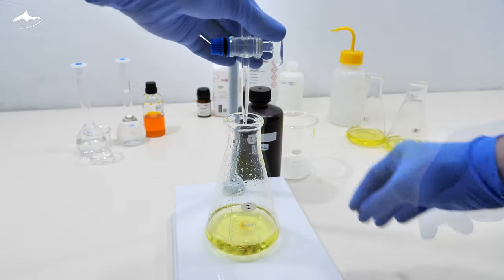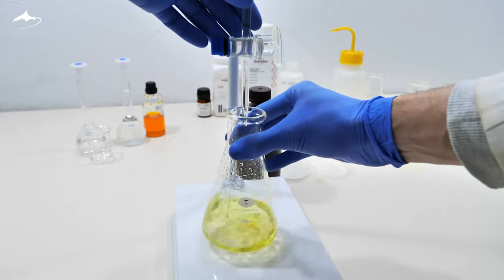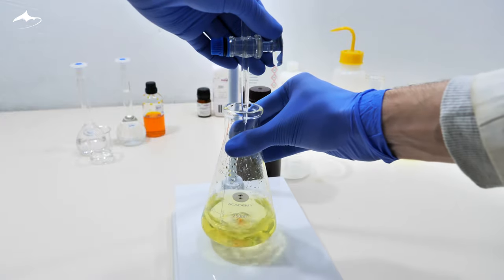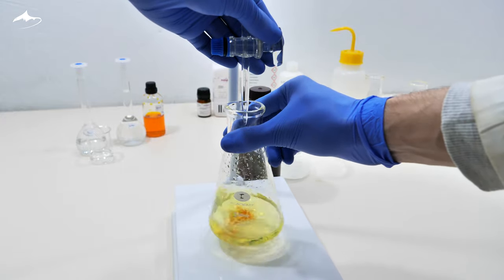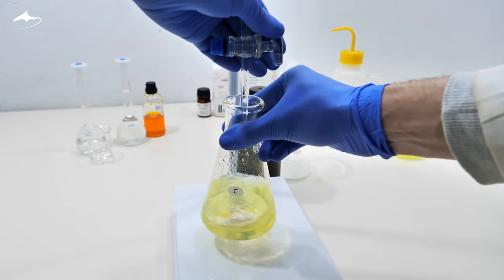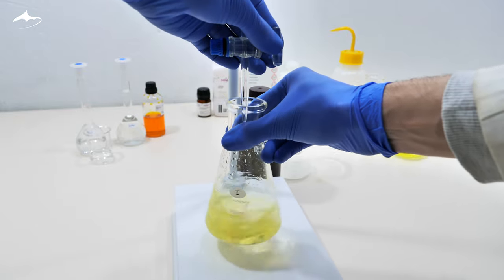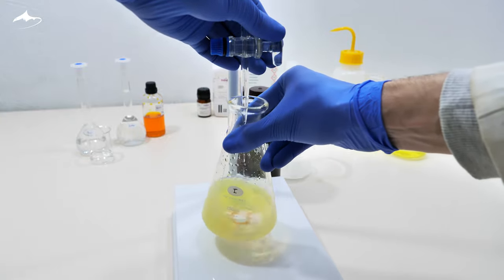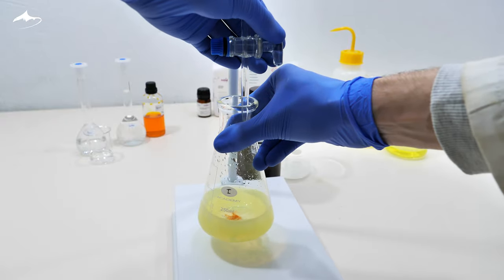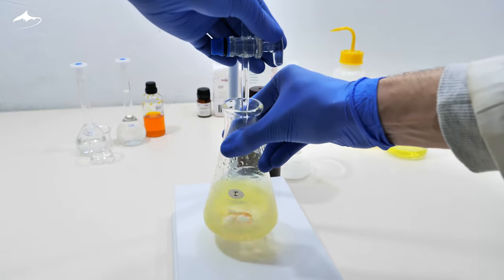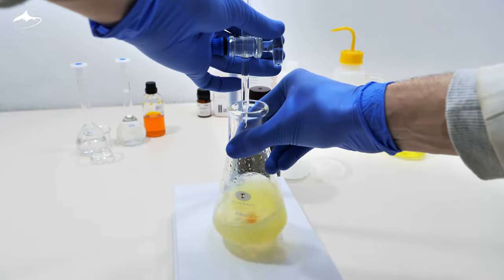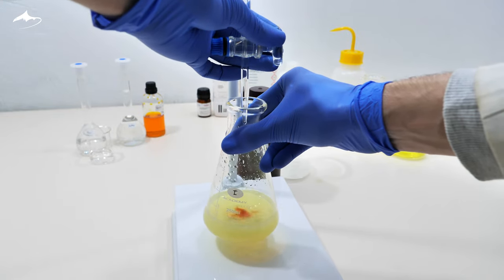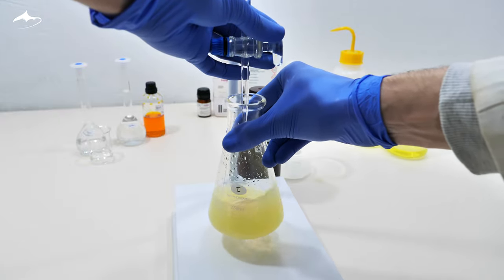Now it is all ready to start the standardization. Look how a red color develops first to then disappear due to the presence of free chloride ions. That tells us that silver chloride is, as I said earlier, less soluble, but kinetics of silver chromate formation are faster. As the procedure progresses, the solution turns opaque due to the formation of colloidal colorless silver chloride. But the most important thing is to keep an eye not on the opacity, but on the hue of the color. As soon as the slightest red color remains, the endpoint has been reached.